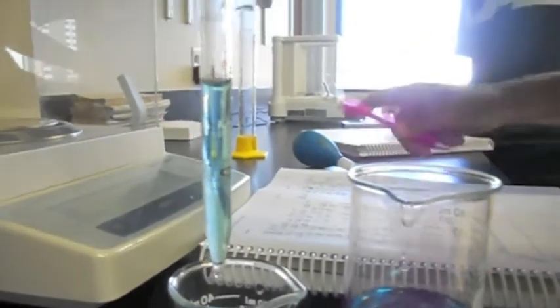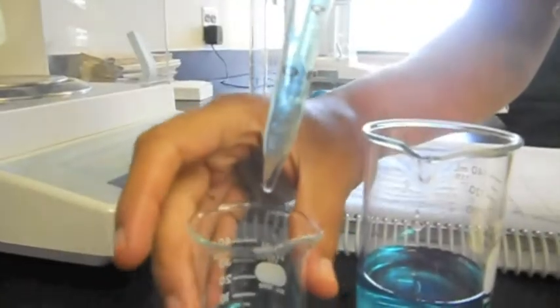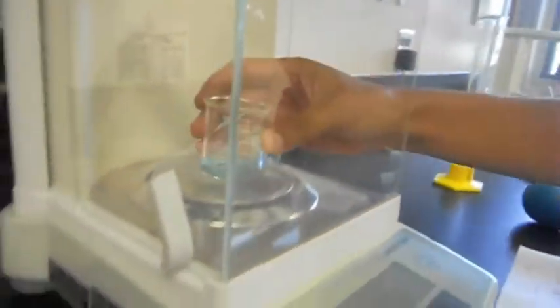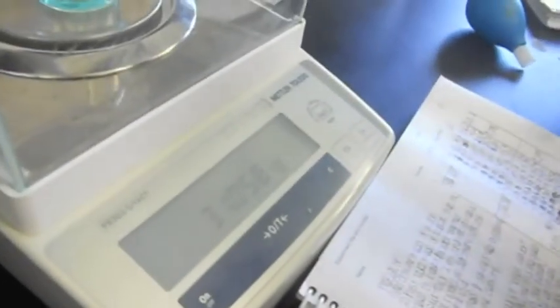And you'll weigh it again, doing the final mass at 31 grams.